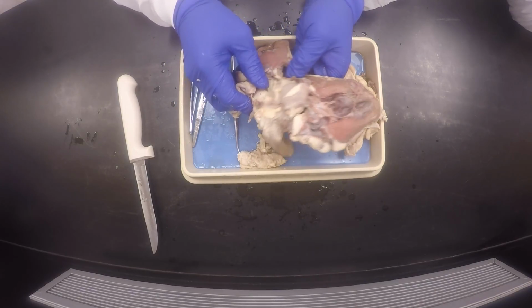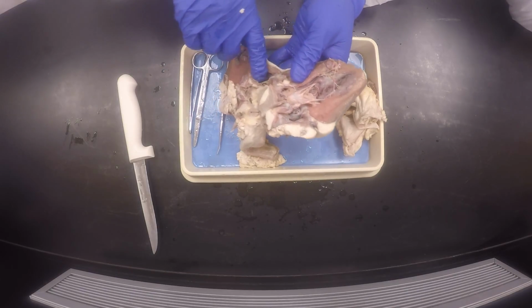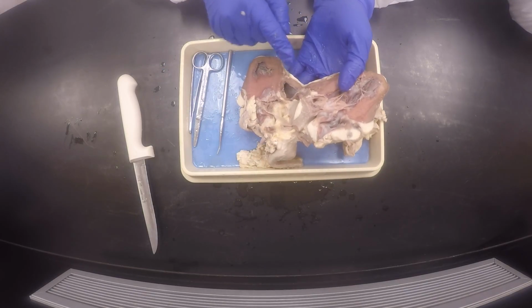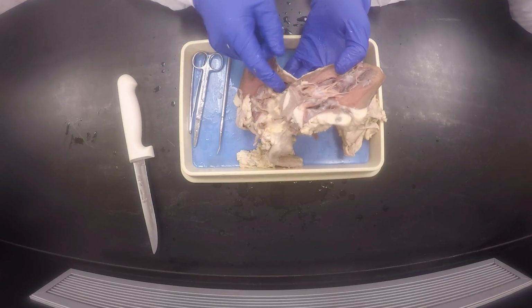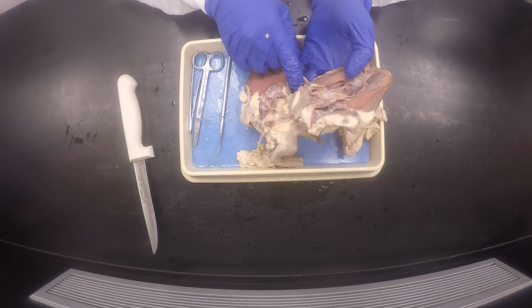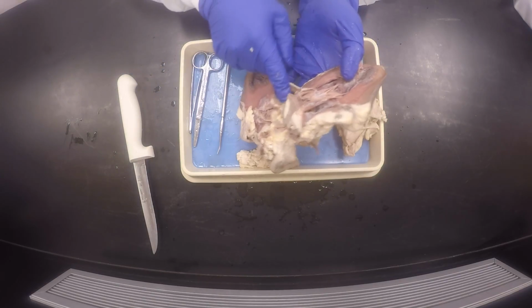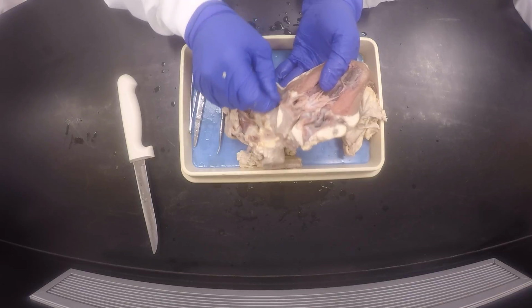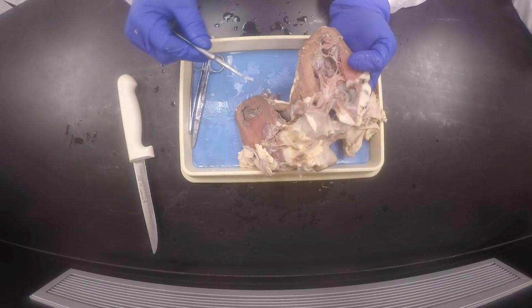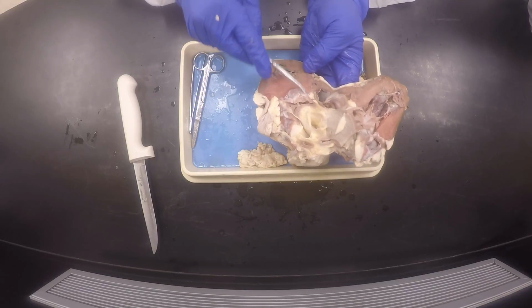And inside the heart, this is the right ventricle. To find the moderator band, which is a sort of stringy tissue that attaches one side of the ventricular wall on the right to the other side. It kind of moderates how much the right fills up. That is the moderator band, and we can't see it because I didn't quite cut in the middle. I didn't get so lucky. But I'll do another heart next time. And this split is the interventricular septum.